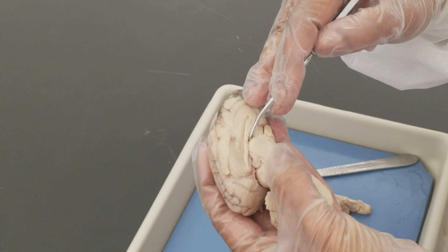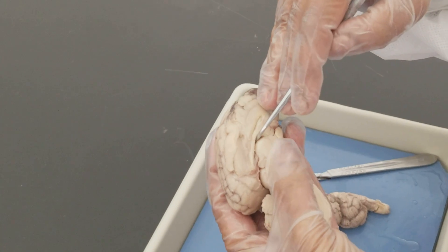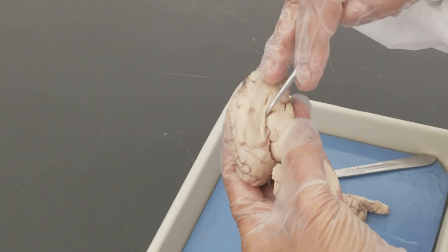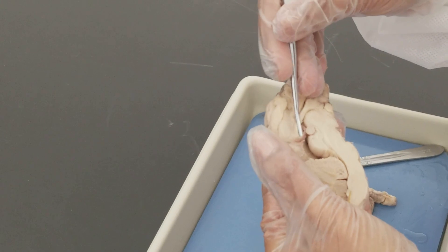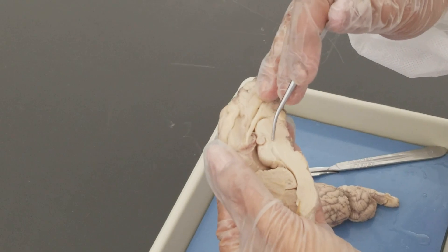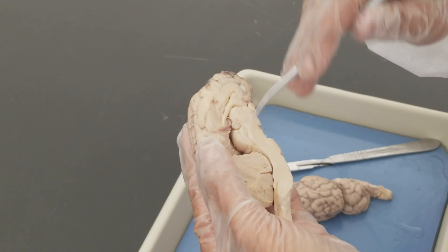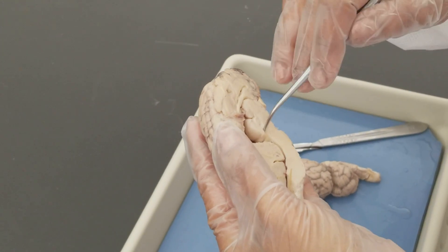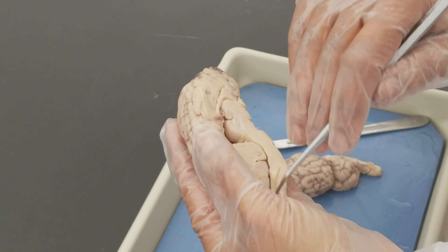The epithalamus also surrounds the third ventricle, another cavity in the brain containing cerebrospinal fluid. The lateral ventricles also contain CSF. You can see the choroid plexus — the dark pigmented area — which makes the CSF. The third ventricle is around the thalamus, and continues into the cerebral aqueduct, also called the aqueduct of Sylvius. This connects the third ventricle to the fourth ventricle. From there, cerebrospinal fluid goes down into the central canal of the spinal cord.